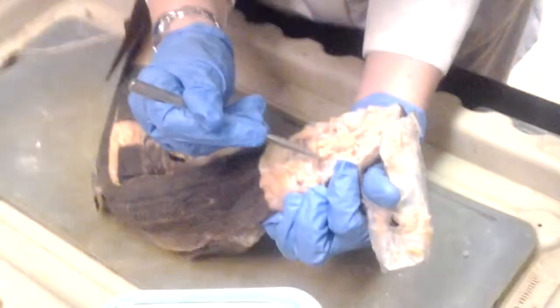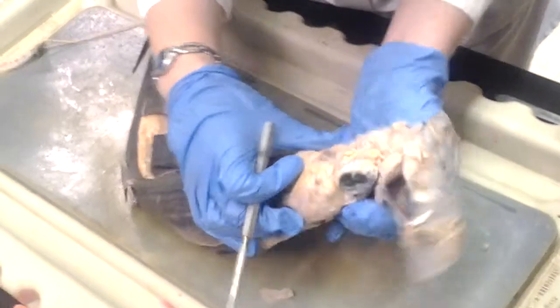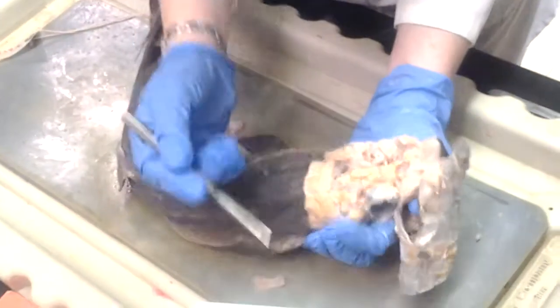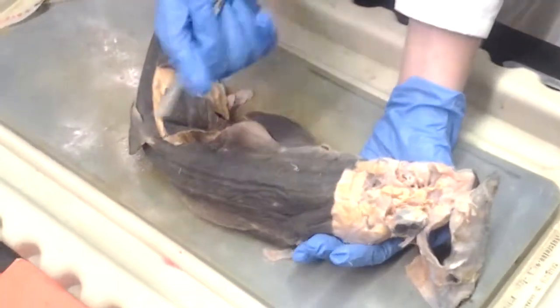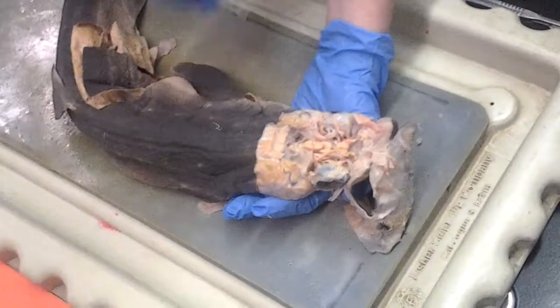And the pedicels are underneath them. There's a ventral rectus, but we can't see it here. We have to turn the eye over. Did you guys do the ventral muscles? No, we didn't look.